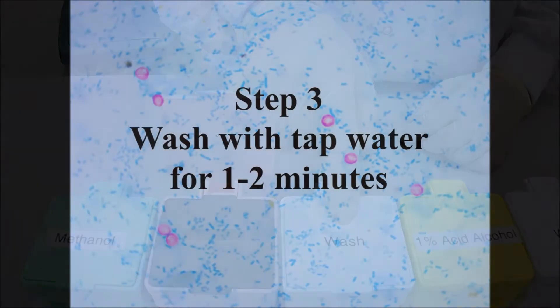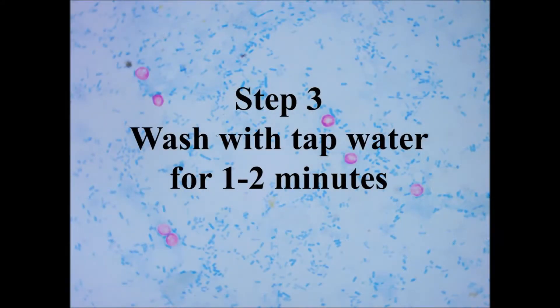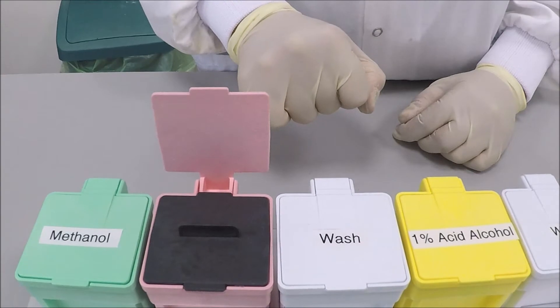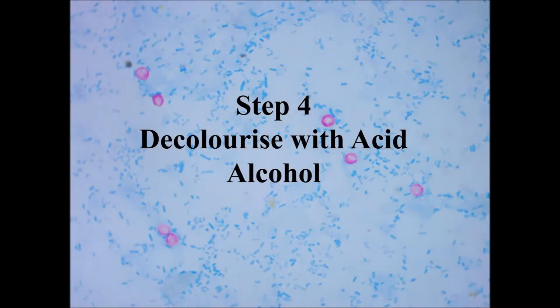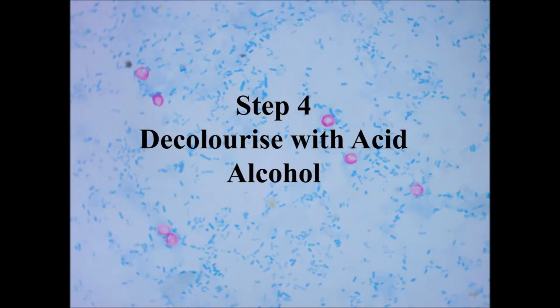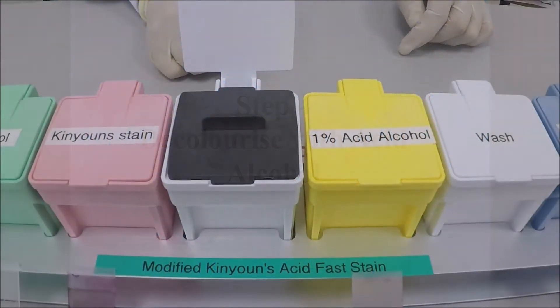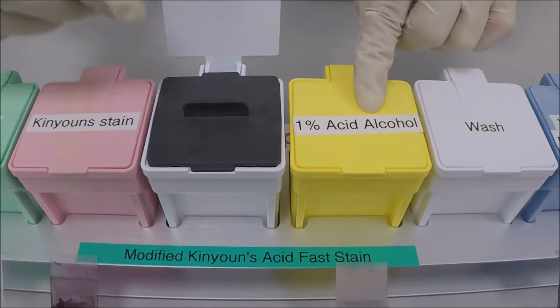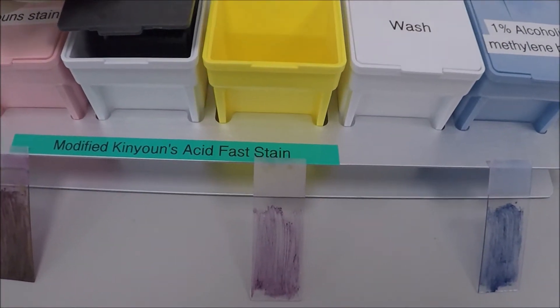Step 3: wash with tap water for 1-2 minutes. Step 4: decolourise with acid alcohol. This will decolourise your background but not your oocyst.